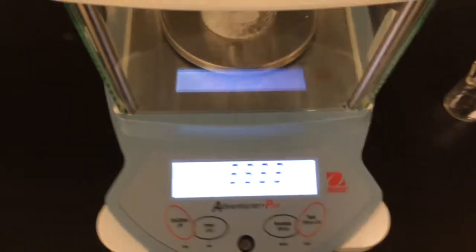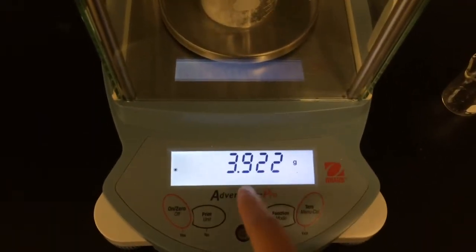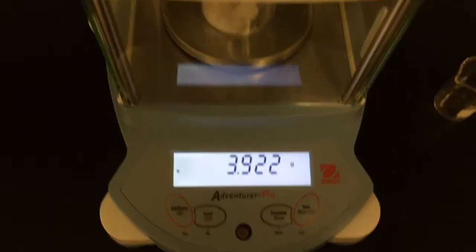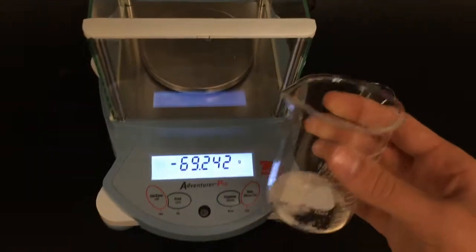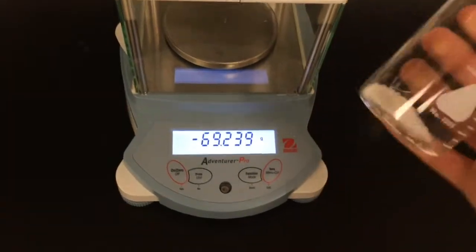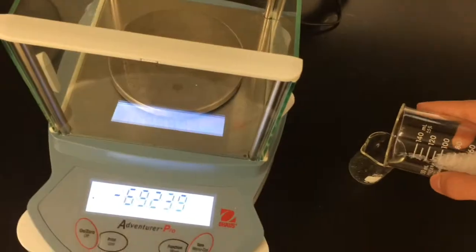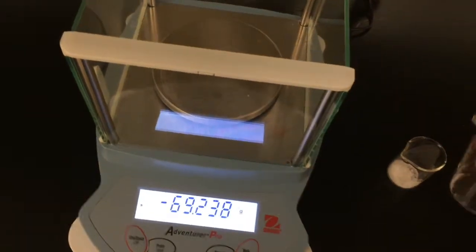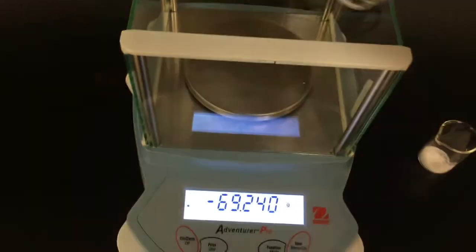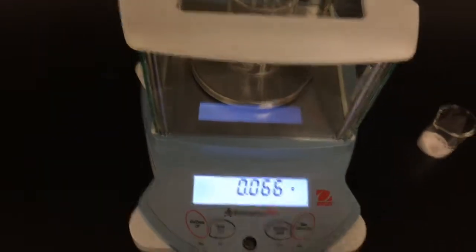Now, lots of times you're going to do this, and then you'll find this amount, but then you're going to use the substance, taking it out of the beaker. You're going to take the substance out of the beaker and then use it. So let's just say I use it. I'm just going to pour it back in here. So I used all the substance, or supposedly all, but you can see there's still some substance left in the beaker. So I'm going to mass the beaker once again with this still zeroed as to the beaker.